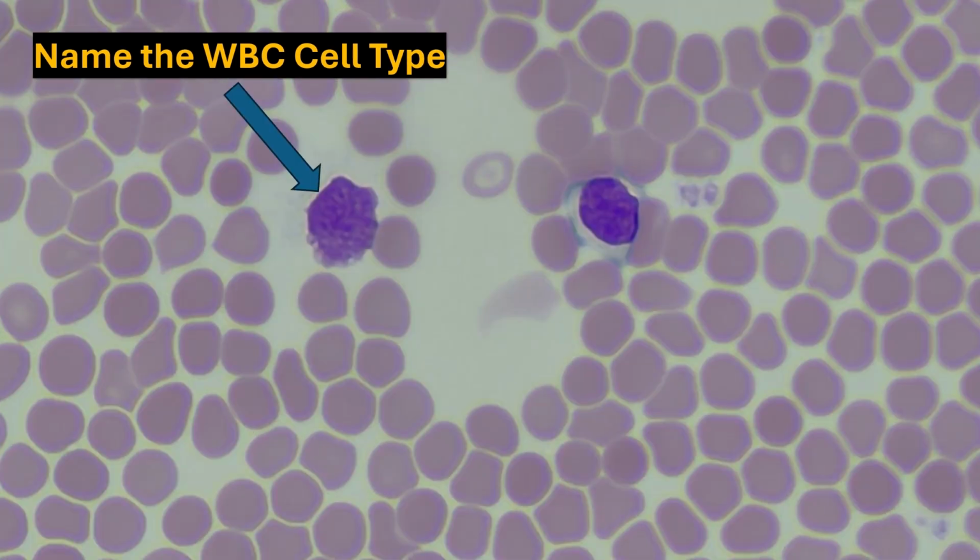There are actually 2 different types of leukocytes here. The bananas in our mnemonic, that is basophil, is our rarest leukocyte and is the one over here on the left. I have a lymphocyte here on the right for comparison purposes because they can be easy to confuse.